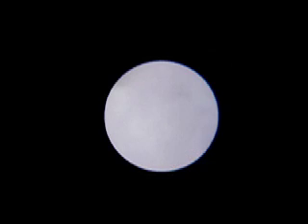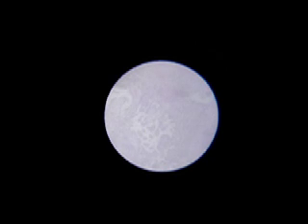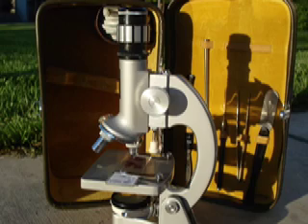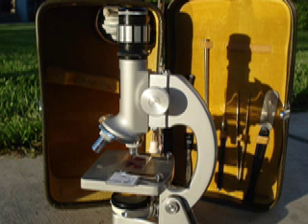Here's an example of a focusing image. Are you ready to use a microscope? I hope you enjoy the world of microbiology.